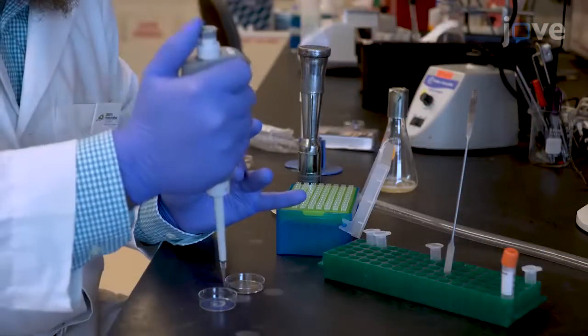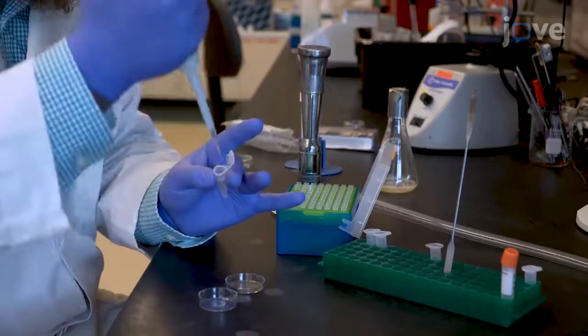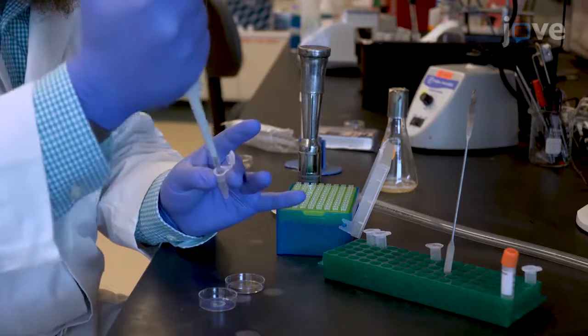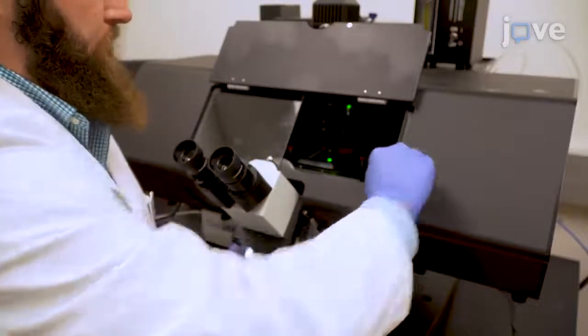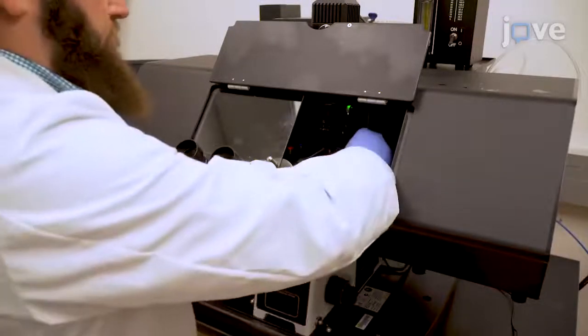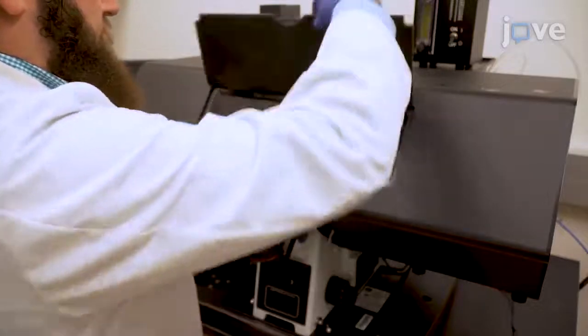Then add approximately 5 microliters of water around the cover slip to prevent the agarose pad from drying and allow the culture dish to equilibrate to the temperature inside the incubation chamber of a high-resolution deconvolution microscope for 15 to 20 minutes.